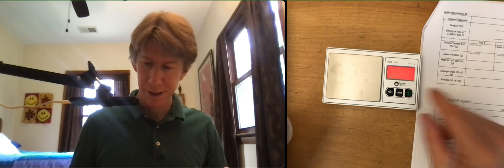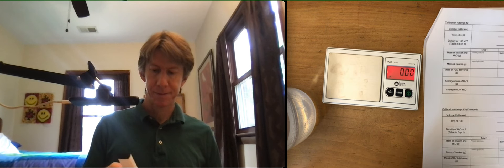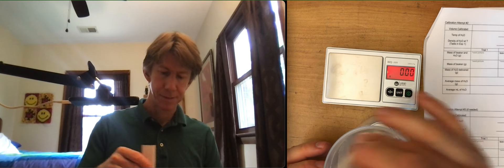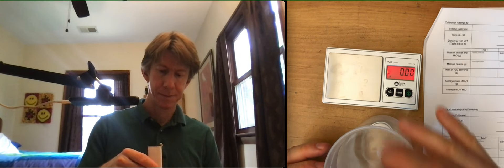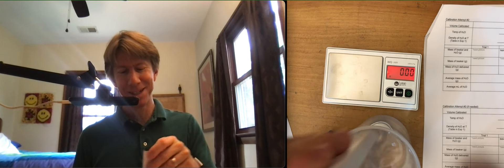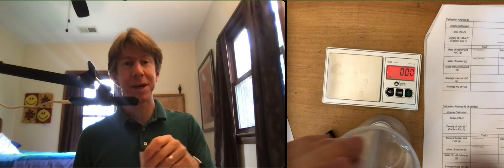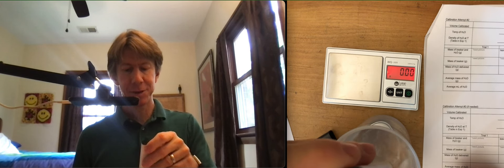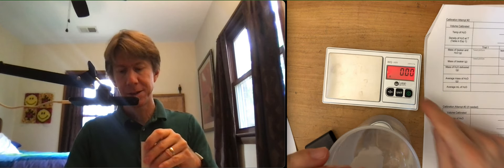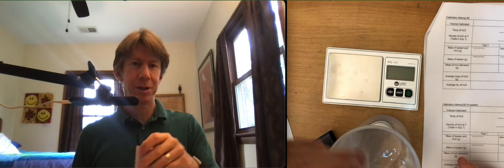Oh, no. The first thing is take the temperature of the water. And I think my room is a little warmer than my water is right now. Because my temperature is going back down. Takes a few seconds, but this thing is pretty good. I'm going to turn off my scale while I'm waiting here.